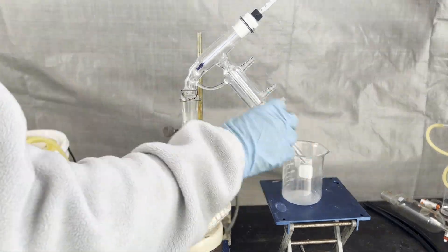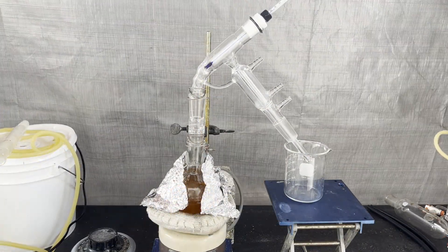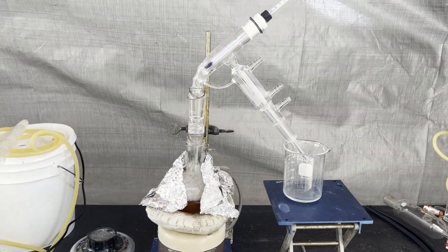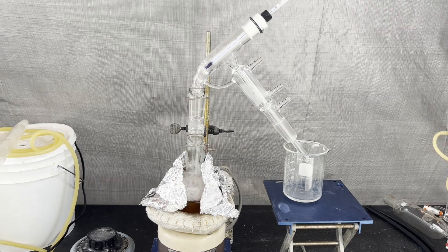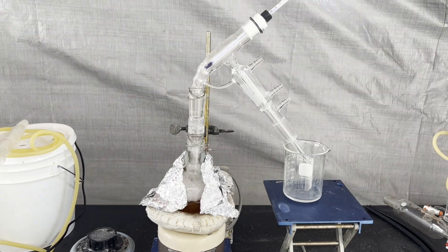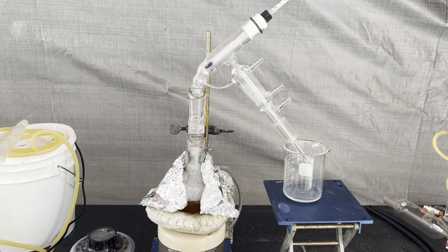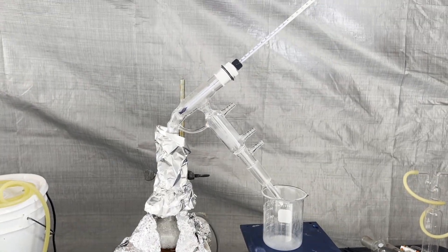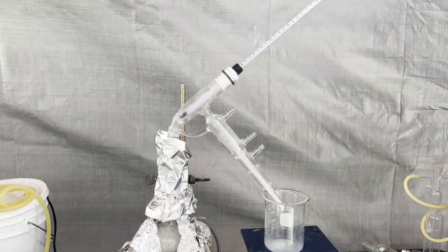PDCB boils at 174 degrees, TCB boils at 213.5 degrees, so I tried to do a short path distillation first with the air-cooled condenser. This didn't separate the compounds sufficiently, so I did an additional fractional distillation with a vigreux column after this.